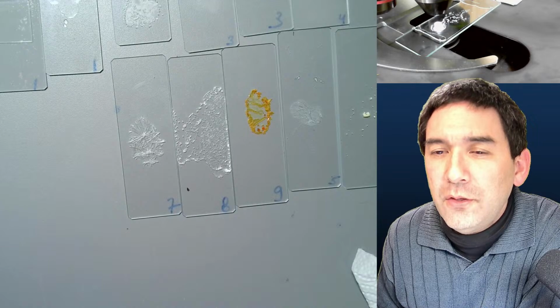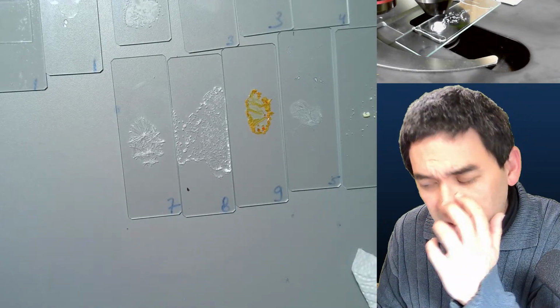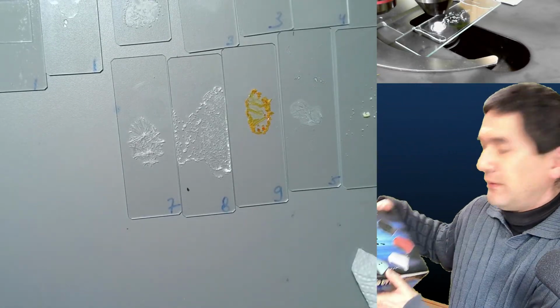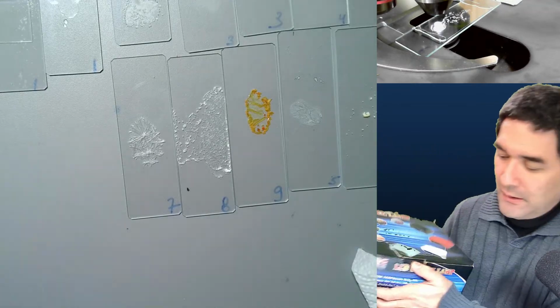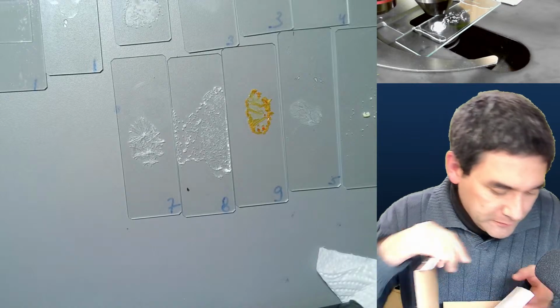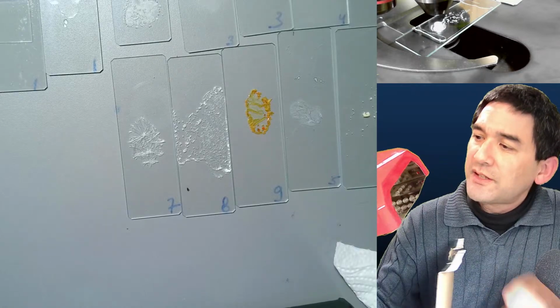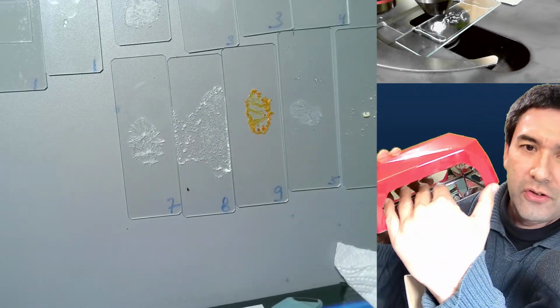Under what name can you find such a UV device in stores, a UV torch? What they have is, you know what? Just a second. Here, actually, I have a box here. It looks like this, the UV gel lamp, and I just unpacked this here as well to show you. It looks like this, and there is some UV, and then basically people put their fingers in here to get it cured.